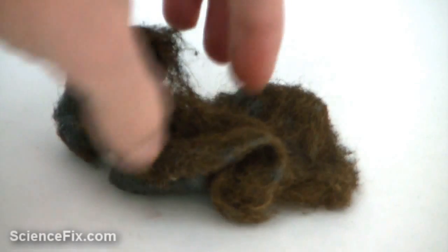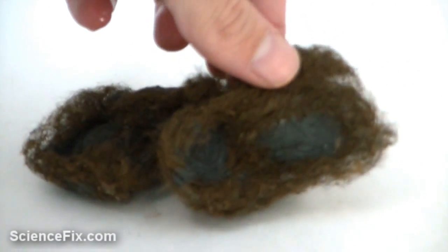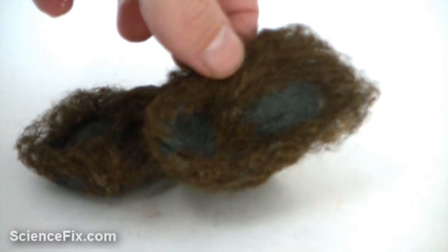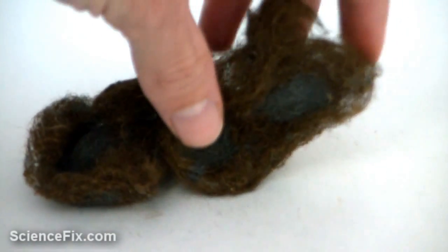Iron oxide is known as rust. You can see that it's a different color, that brown color. And also, it's very brittle. It's powdery. It comes off the rest of the steel wool, the iron, that has not reacted. So it's a fine powder.